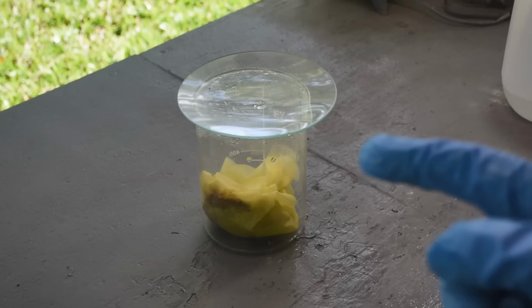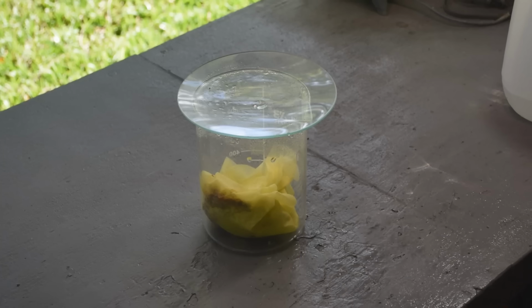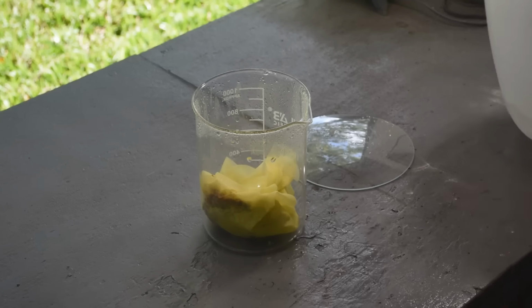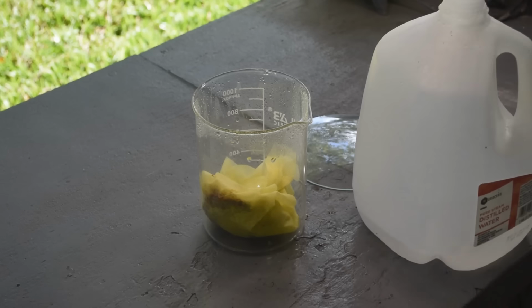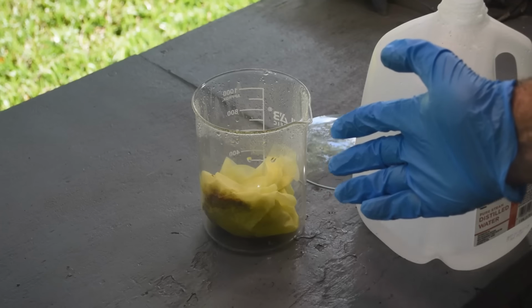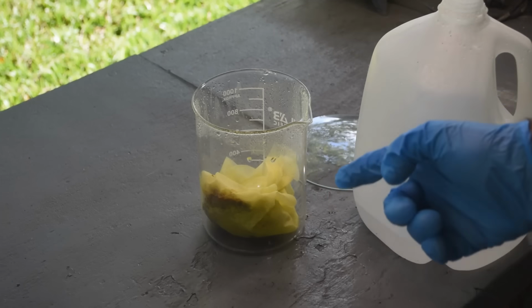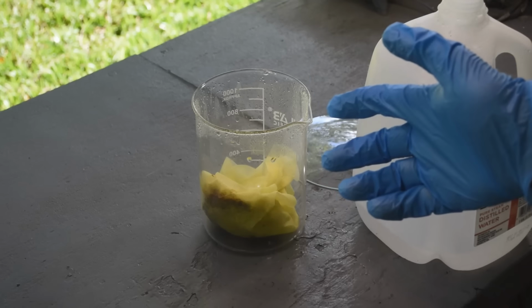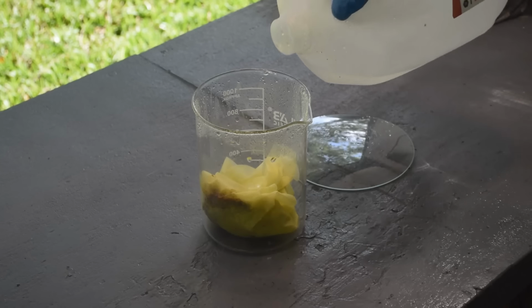Okay? So step 1 is getting this red salt back into solution. And how am I going to do that? Well, it's water soluble. If you watch the other 6 episodes in this series, you know that I was using a saturated solution of ammonium chloride with this stuff because that wouldn't dissolve the red salt, or I was using hydrochloric acid because it's not soluble in that either. But we're going to put the distilled water on this stuff.